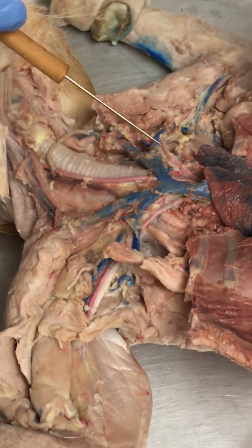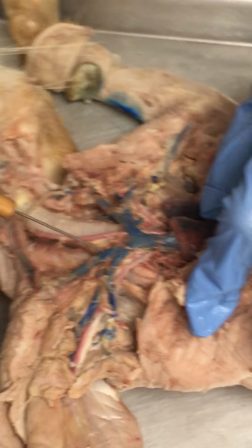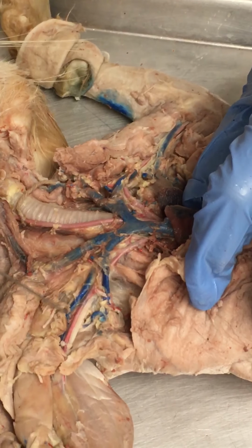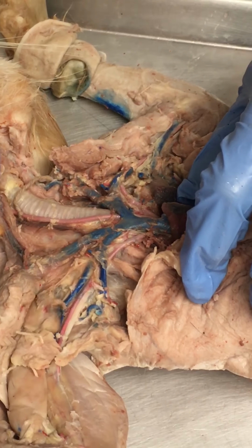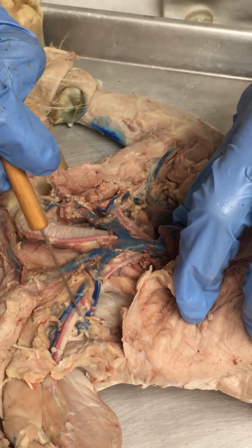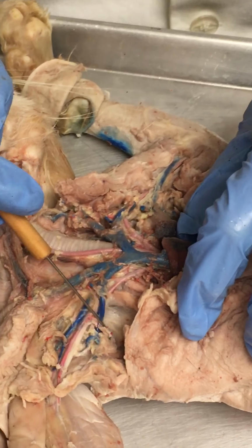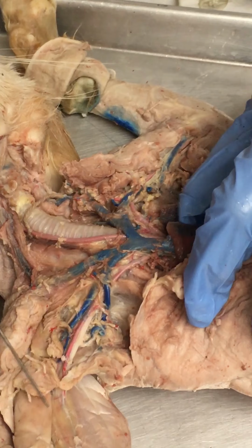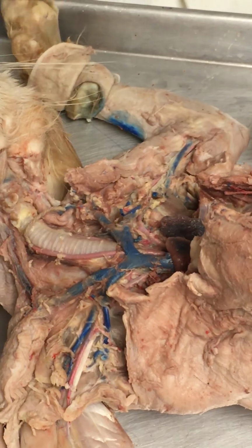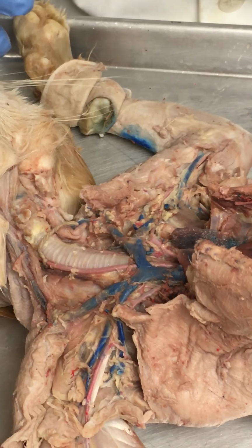Let's see, we didn't do it on the right side, but we can run through it real quickly here. I haven't cleaned it all out, but we've got brachiocephalic, external jugular, subclavian, and here's where it looks like not a lot of dye. Looks like we hit a point where the dye just kind of stopped. It didn't get out into the blood vessel down here, so probably not going to be worth our time to go through it. As long as we have one good side, we're good, because the two venous sides are just mirror images of each other. Whatever's on the left, same thing's on the right, we just call it right.